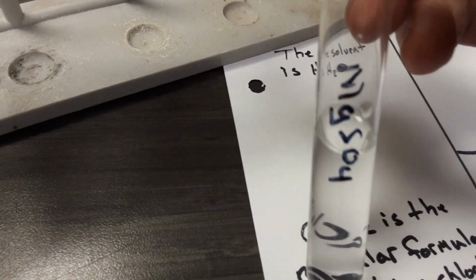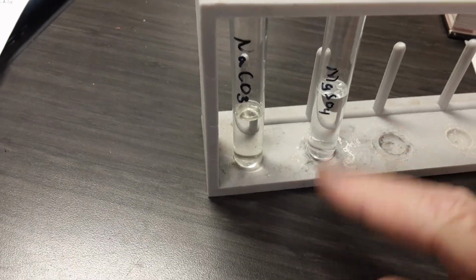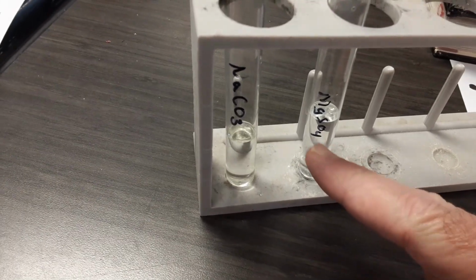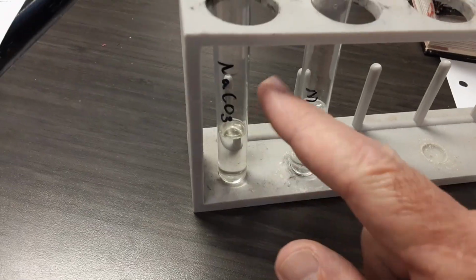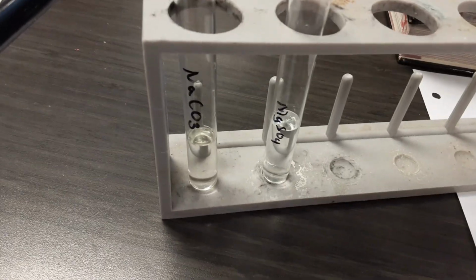And we also have decanted some of the magnesium sulfate. Once again, there's no solid particle hanging around in there. We've just got a solution. There is no way to tell in this current state that there's more than one thing in there. But we know there's magnesium sulfate with water mixed, dissolved, makes a solution, and sodium carbonate that's mixed and dissolved and formed a solution. Neither one of these is the result of a chemical reaction because a new substance was not formed, just two things were mixed together.